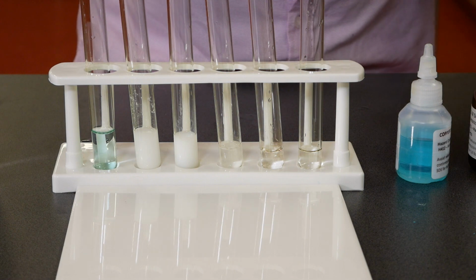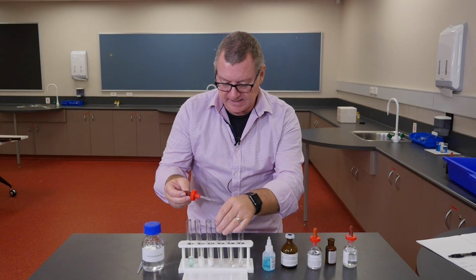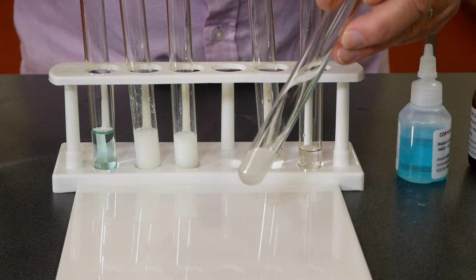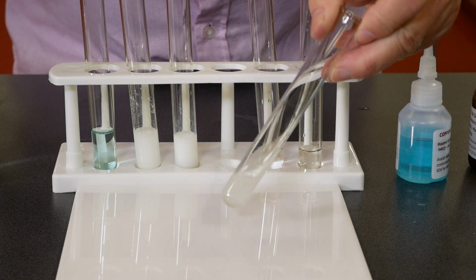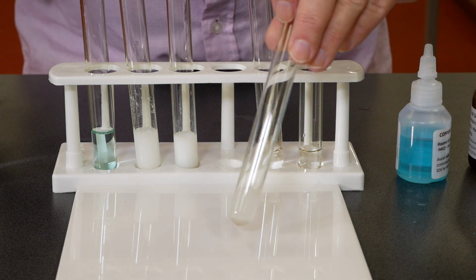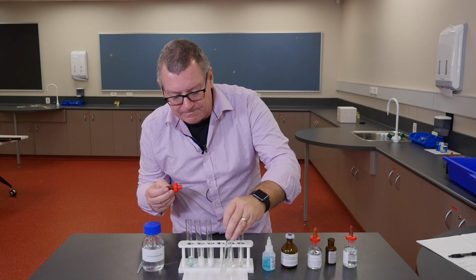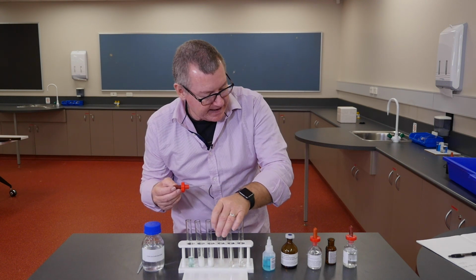This dropper is not capacious, so we'll add just a fraction more of that. We're getting a small precipitate, but it's dissolving straight away again. In fact, by the time I got back to it, there was no precipitate left. So it seems as though it's not enormously soluble, but soluble enough that we can dissolve that much of it in the solution. I think there are some very small fine grains there, but most of it has actually redissolved.